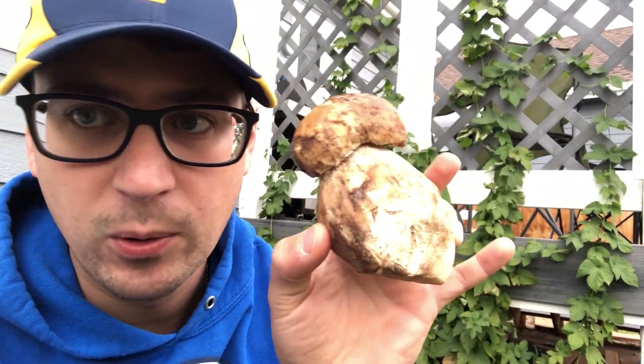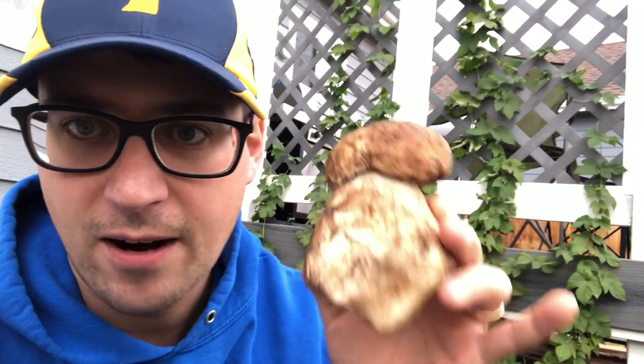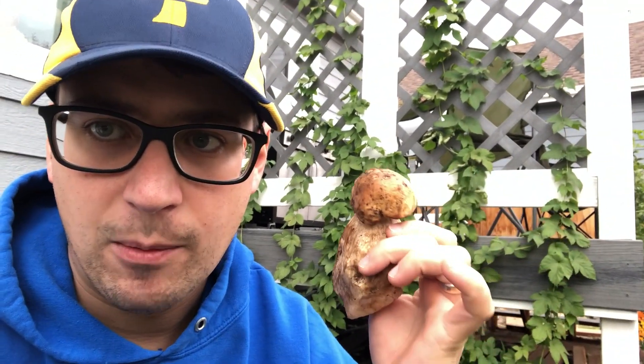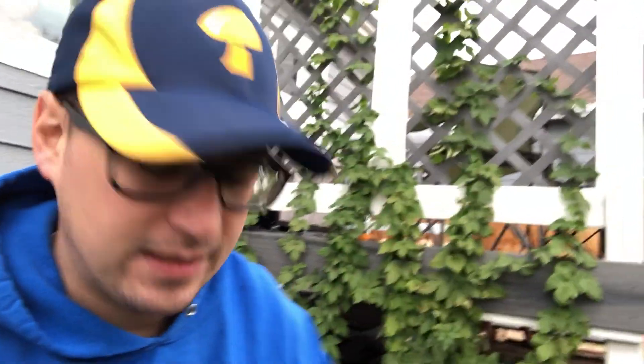That was really inspirational, which is why I made that previous video where I planted the morel patch. I've been working on that for a couple years just trying to figure out how to get morels to fruit. I'm gonna go through and clone this porcini or Boletus edulis mushroom down in the lab. I'm gonna put it on agar, and then over this winter I'm gonna be releasing some mycorrhizal species, a couple of those morel mushrooms that I have, and the chanterelles, and hopefully these porcini.